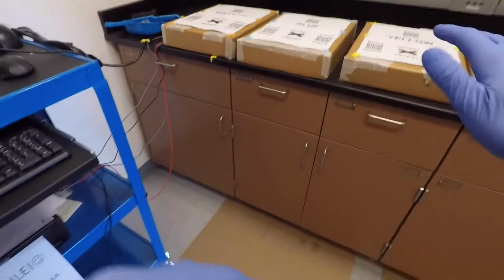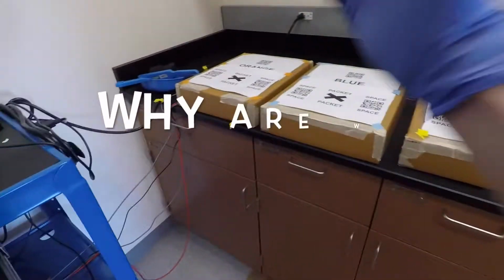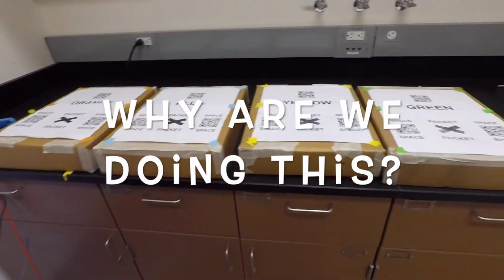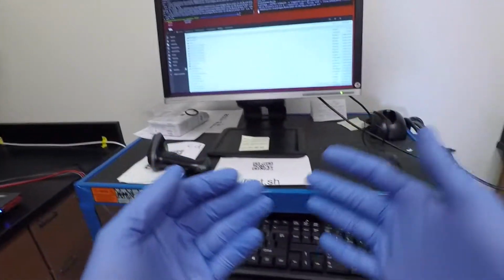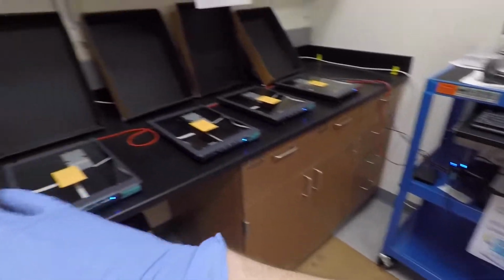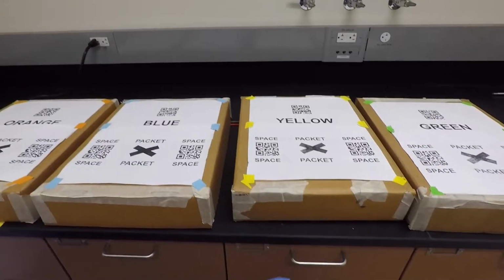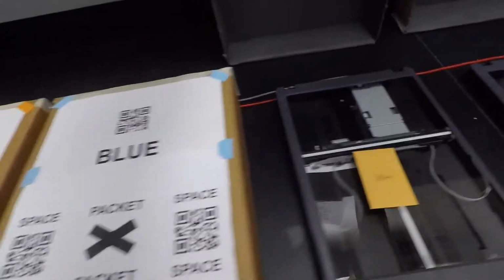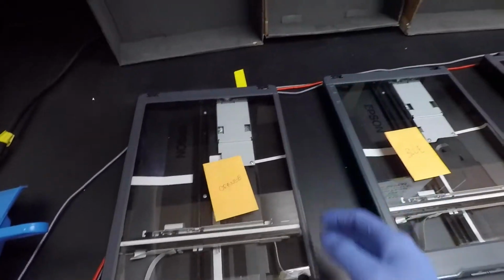We're going to do the same thing. I'm going to wait for these to finish so that we can visually check and make sure they're each operational on the hardware side. And then on the software side, we're checking that we did get an image for each of these. And this is what we want to do when we start every single day, to make sure that the hardware and the software is set up so that we can successfully run our samples. Okay. Green, yellow, blue, and orange.